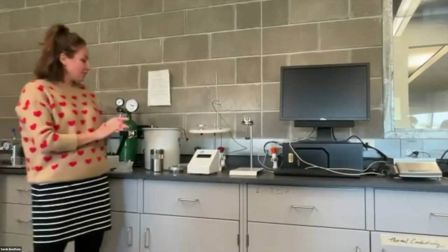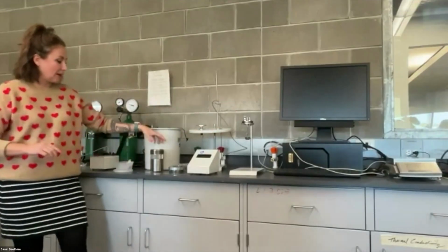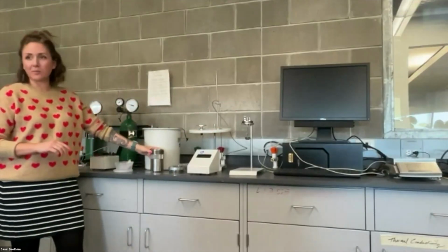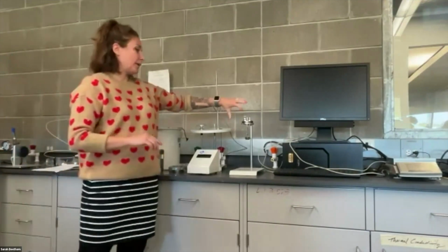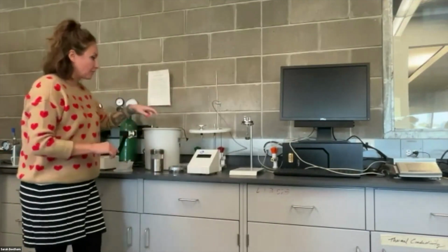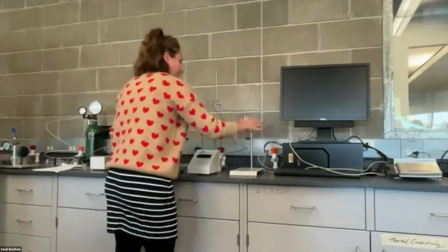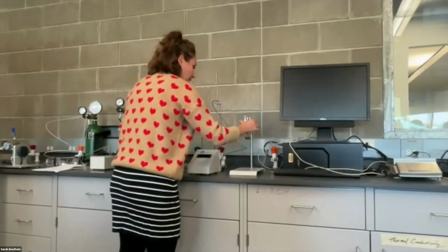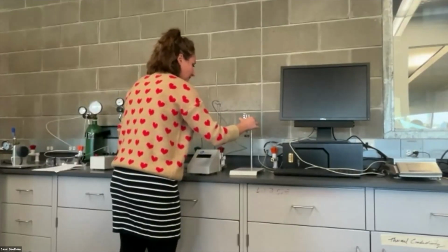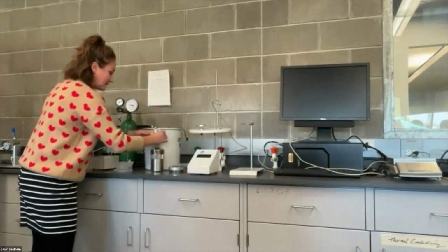Okay, the next thing that we're going to do is we want to very carefully move this lid and put it onto the bottom part of the bomb. That's part of the reason why I twisted this the other way, so I can carefully lift this up out of the holder and get it into here without disturbing the wire and food sample setup that I've just done. This is a little bit heavy, so twisting it around and moving it out, I find to be a little challenging to keep it perfectly still.